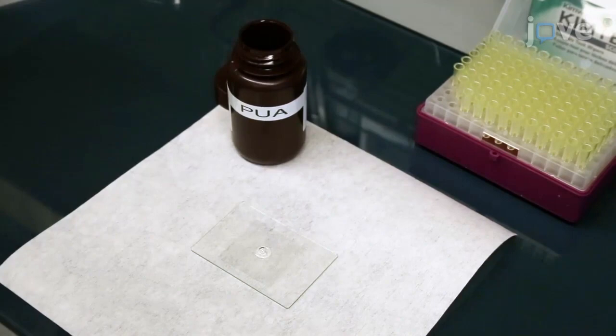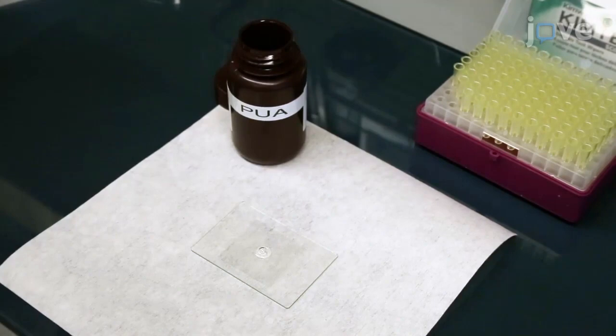Place the AAO filter on the resin and press uniformly using a rubber roller with a diameter of 32 millimeters. The spread of the resin is visually confirmed.